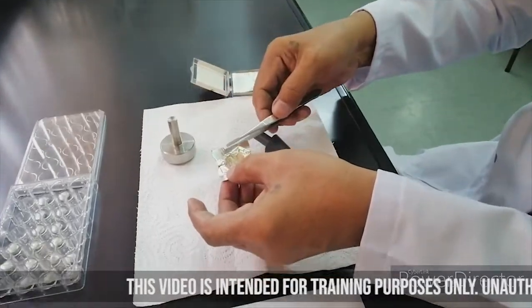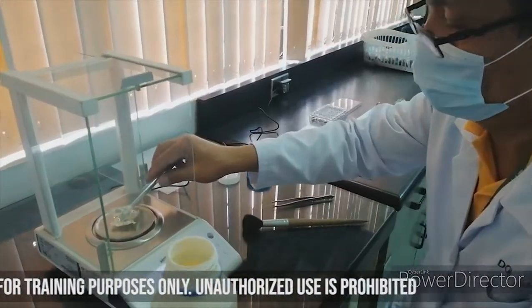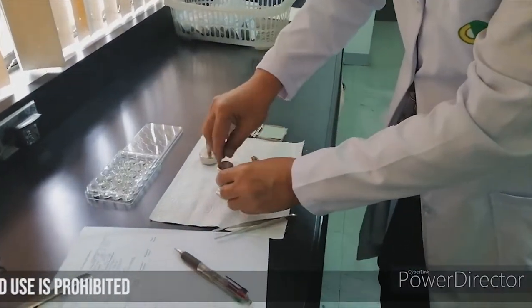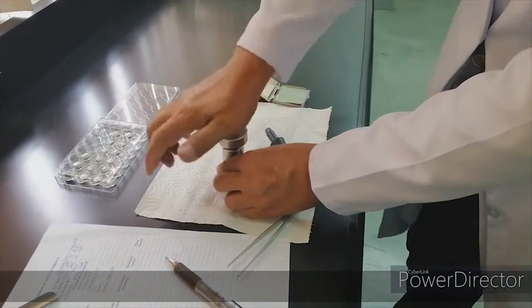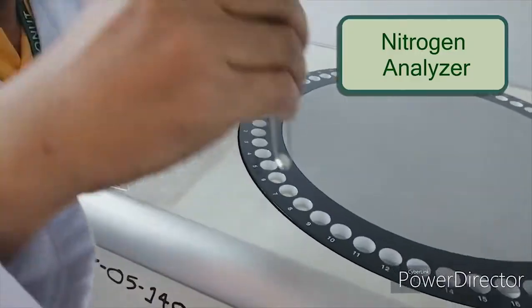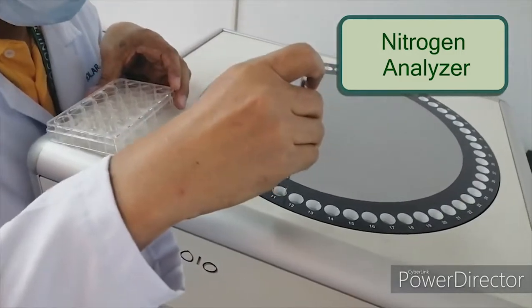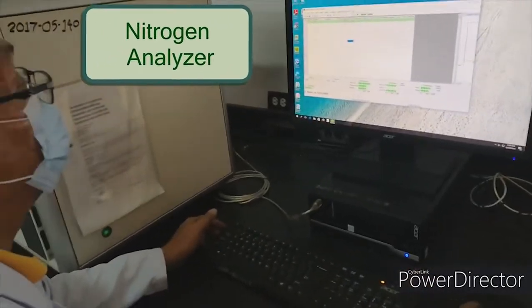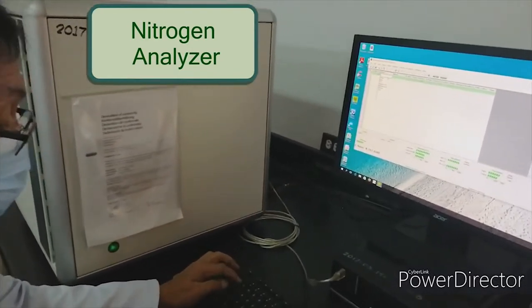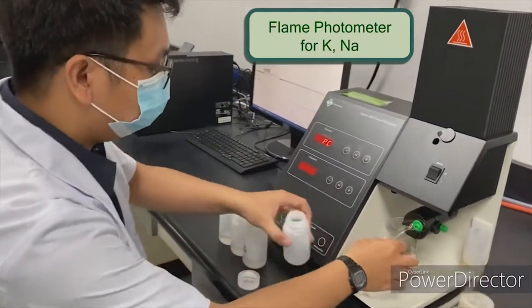A better way of analyzing nitrogen is by the use of nitrogen analyzer, which uses the combustion method. Potassium and sodium is determined using the flame photometer.